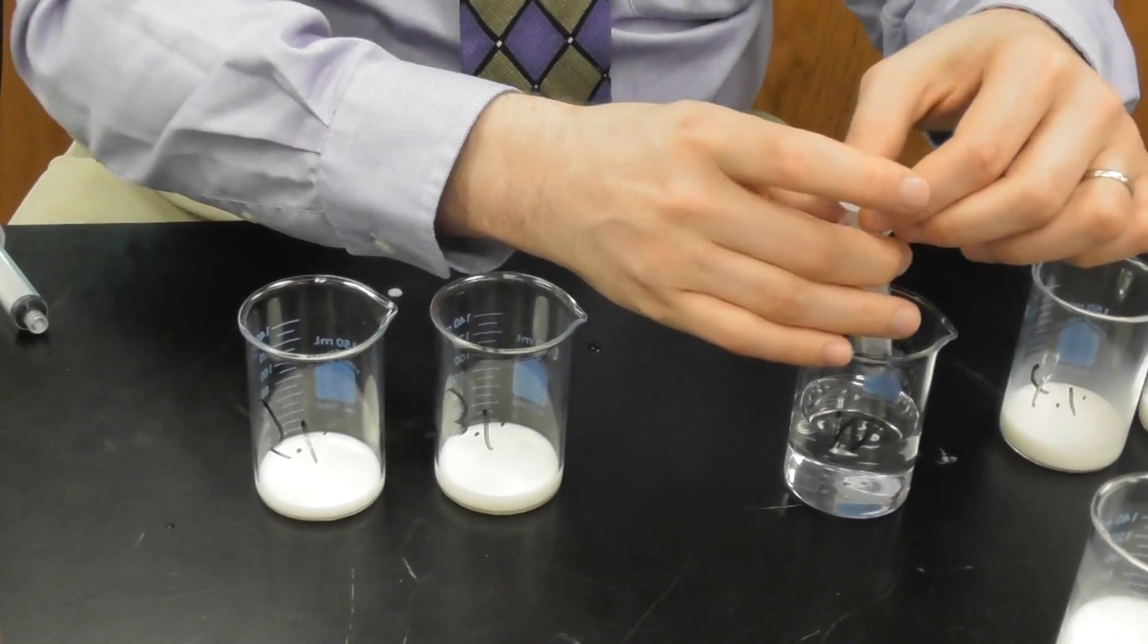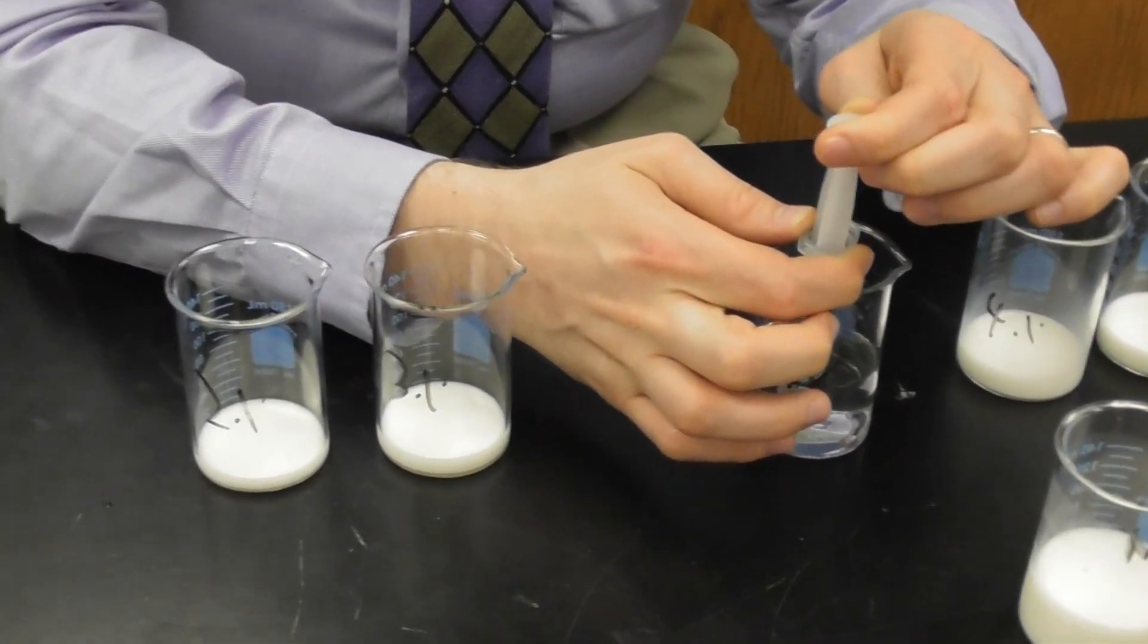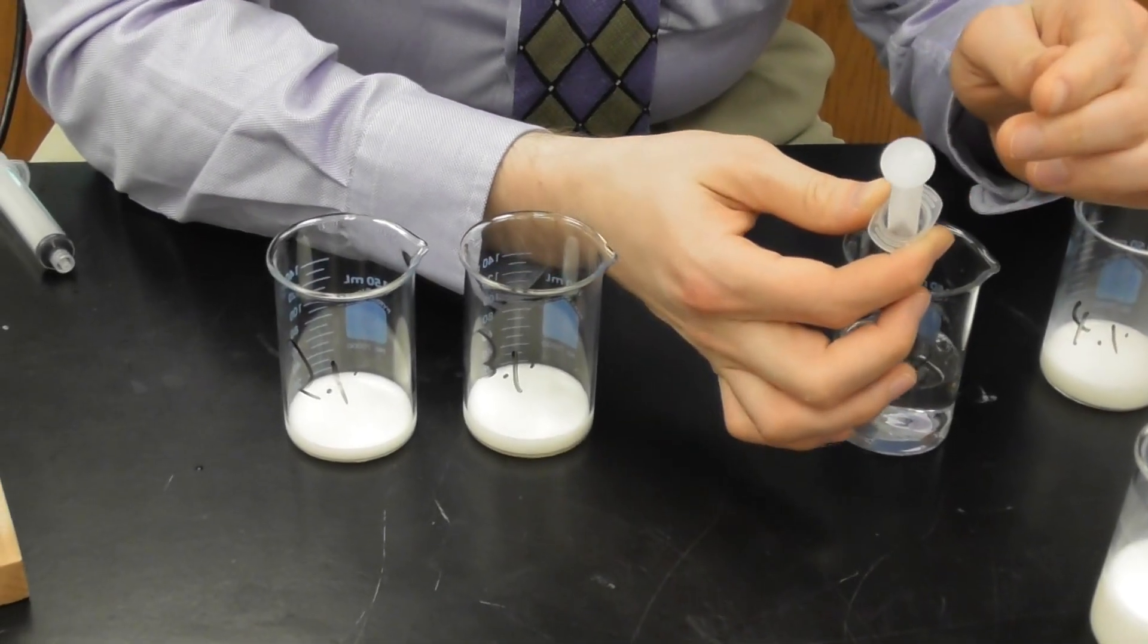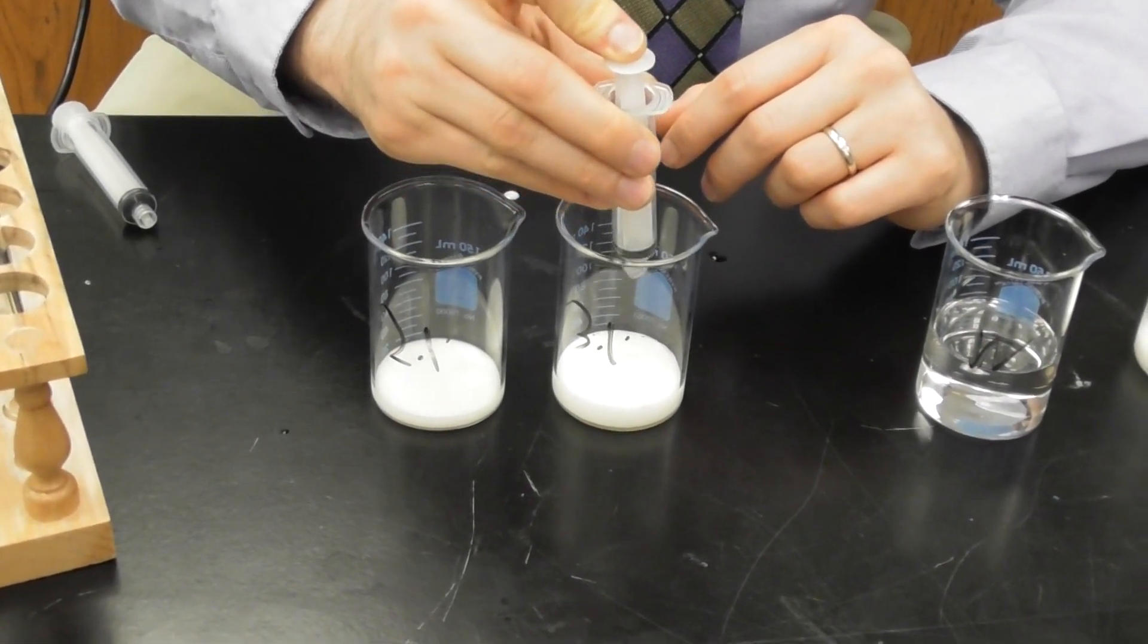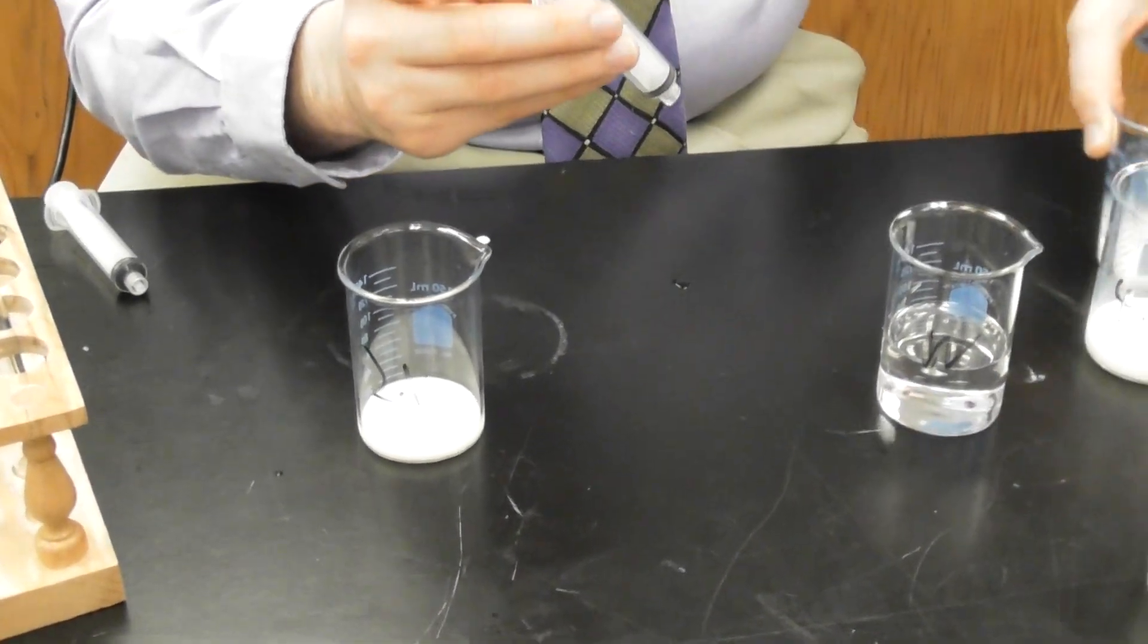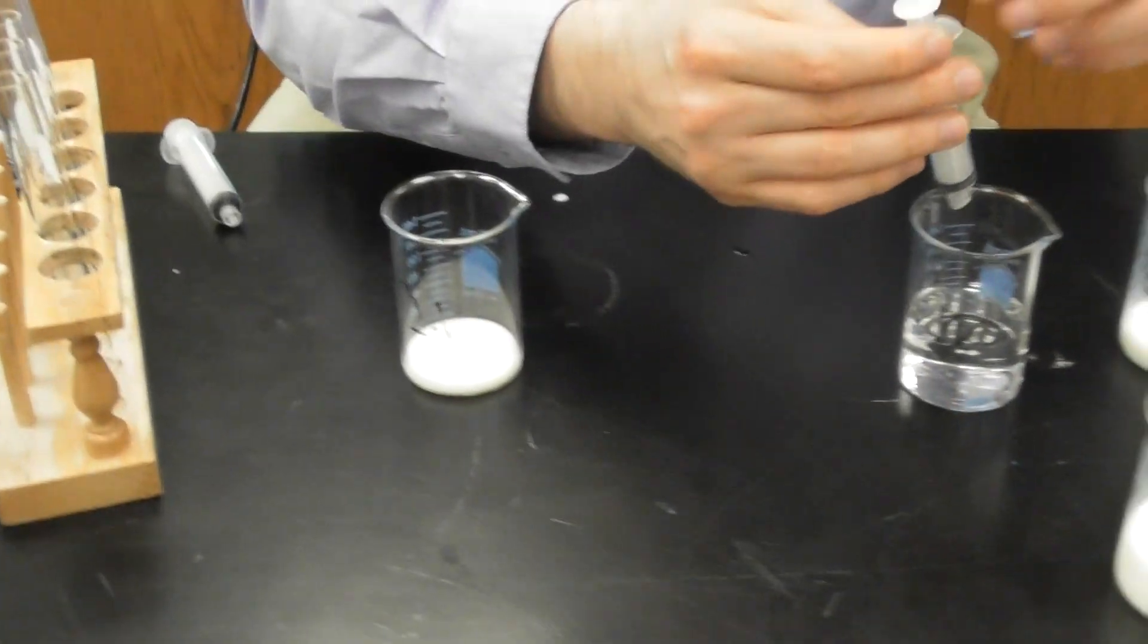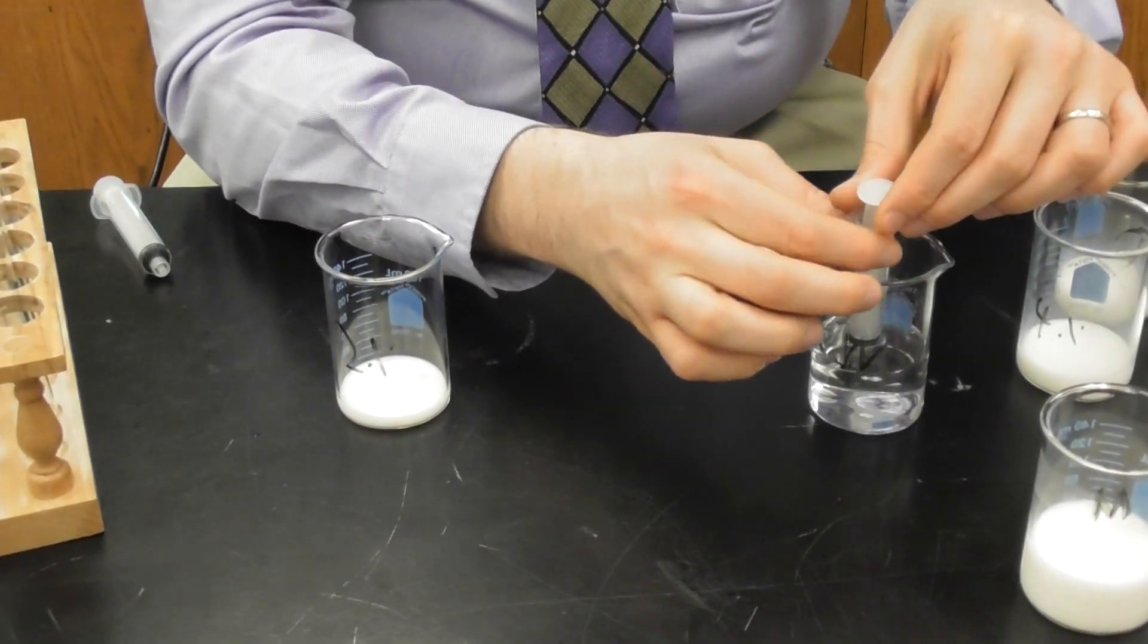For 3%, I used 12, so I need to fill the remaining 8. So there I'm at 8. Fill the remaining 3. I can now swirl this. Put that off to the side so I don't add any more. And now for the 2%, I added 8 and I can fill the remaining 12. Now I need to fill to 10 and now add another 2.